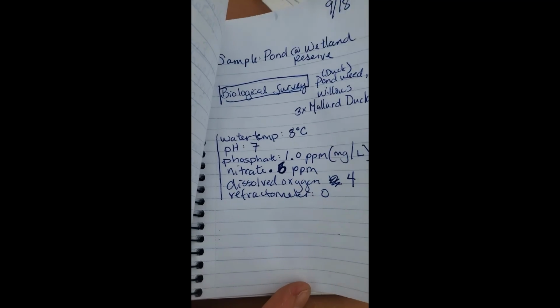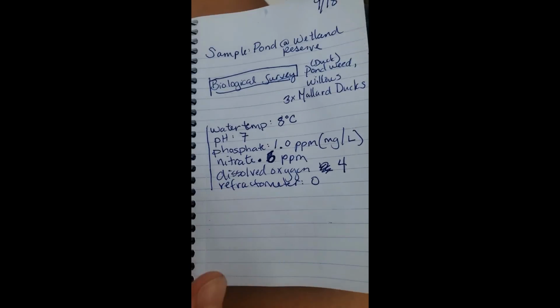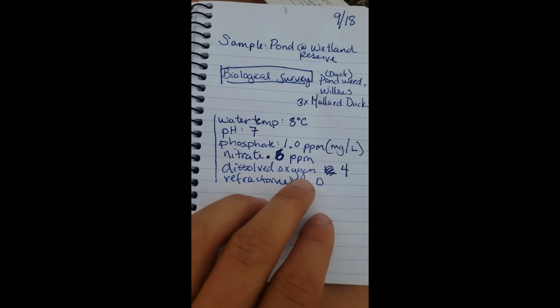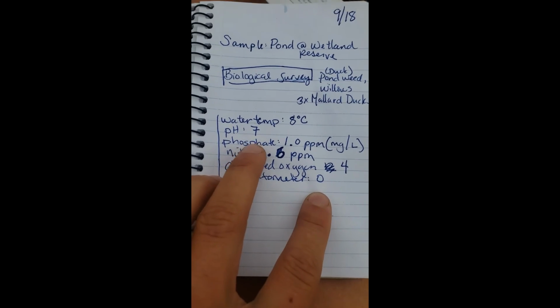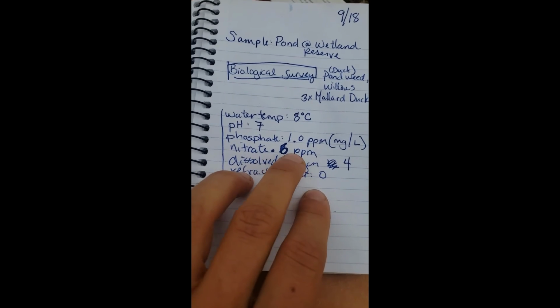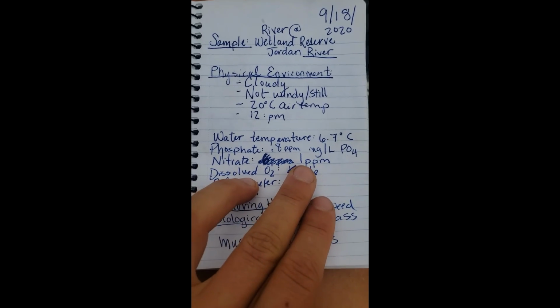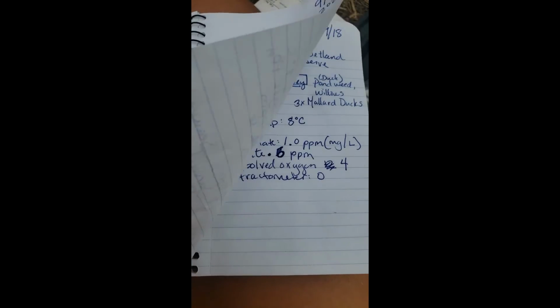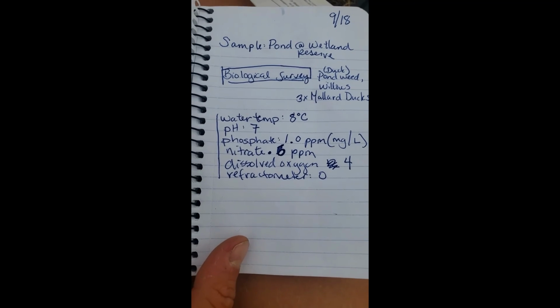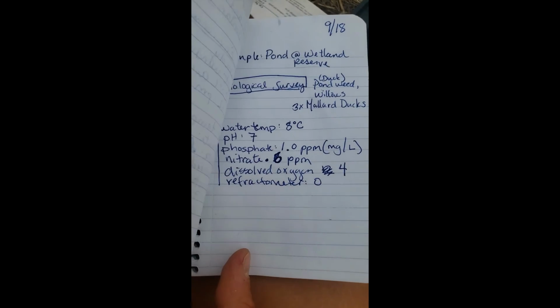And I would say from that conclusion, okay, so using Mitch's hypothesis that there might be more phosphorus and more nitrate, I actually want to go back and test this nitrate. Because here I'm actually questioning the sampling method, which is totally part of science. When you get some data, you can go back and retest and make sure it's reliable. And I want to make sure that that nitrate level is right.